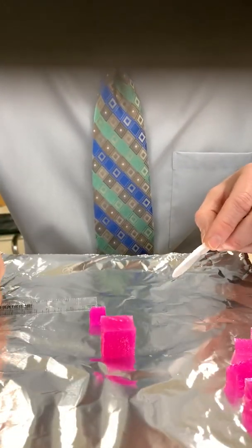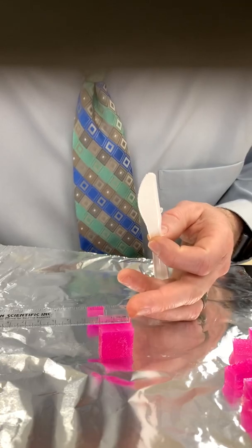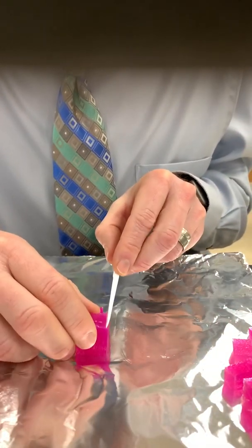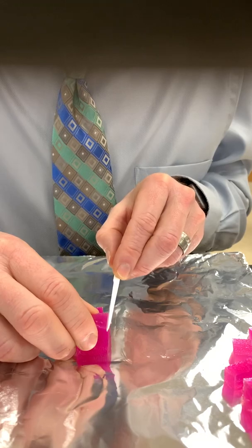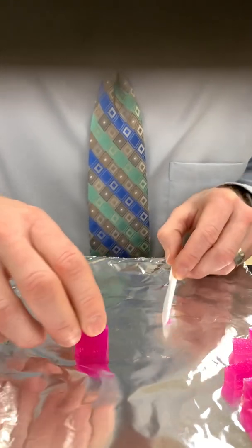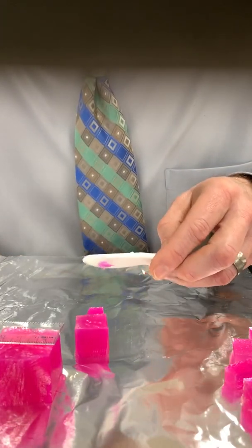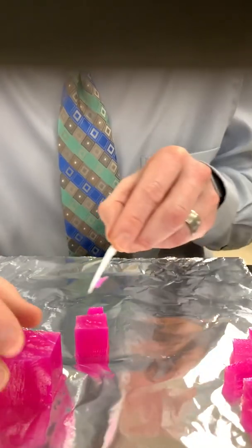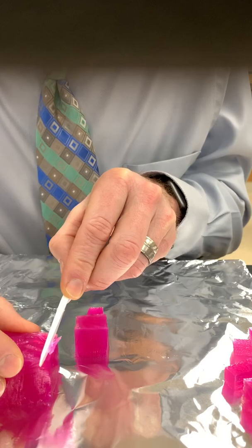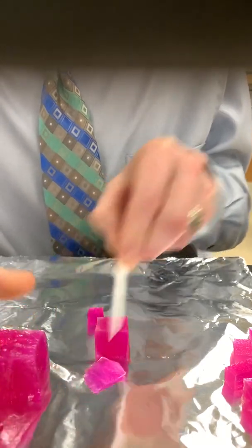Making sure this is still 2x2. It's got a little bit in here. It's pretty good. This looks pretty good, the 3x3. A little bit too much here, but all right.